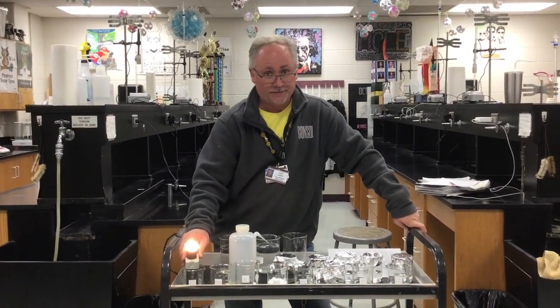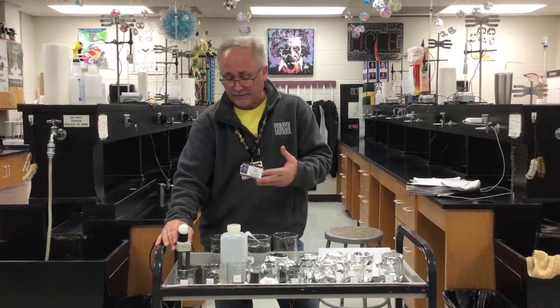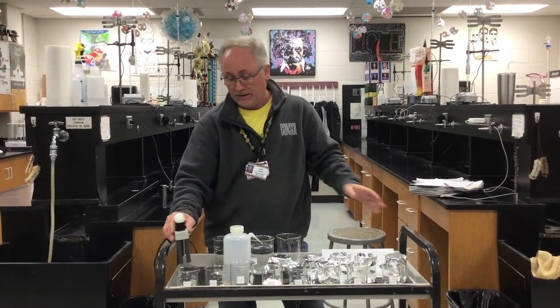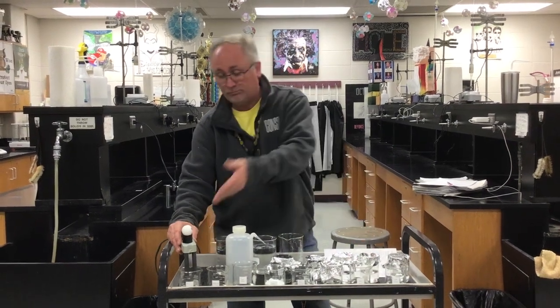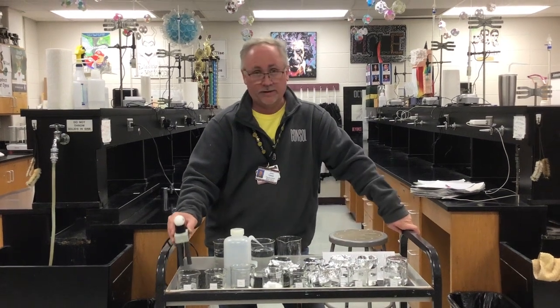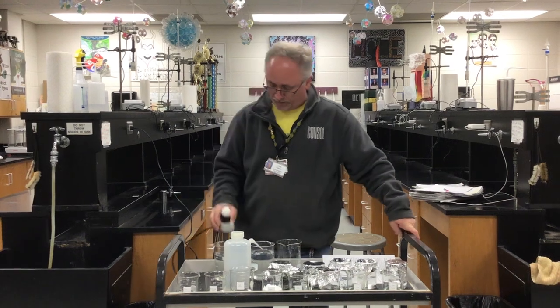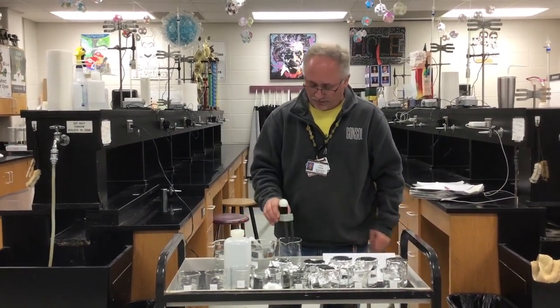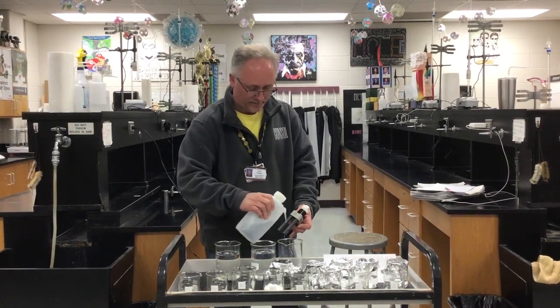If it is very bright, it would be a strong electrolyte. And if it is weak, it would be a weak electrolyte. If you don't see any light at all, it is a non-electrolyte. And that's what you need to write on your paper, where it says observation, bright light. Under comments, strong, weak, or non-electrolyte; for this one you would write strong electrolyte. For the rest, I'm going to go through pretty quickly, rinsing off in between, and if you need to slow down, just hit pause on the video.